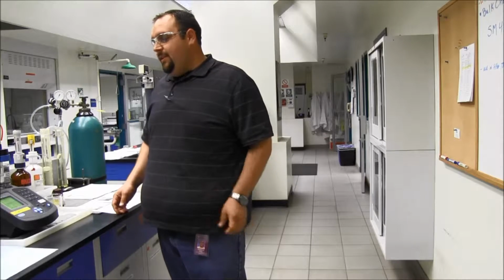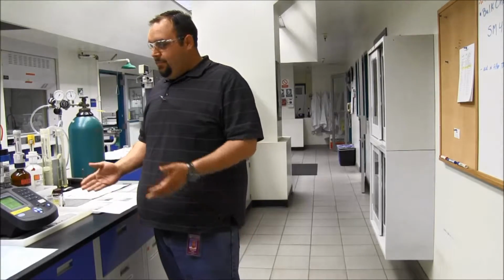We're here today at the City of Phoenix with Andrew Price to show you how to do the chlorine dioxide and chlorite testing by Standard Methods 4500-ClO2 E, using the Hach AutoCAT 9000. Andrew? Yeah, so here we're a water treatment plant, and we feed chlorine dioxide on site, so we have to measure for chlorine dioxide residual and chlorite residual. So that's what we use, the AutoCAT 9000, and I will walk you through the procedure of how we do that.